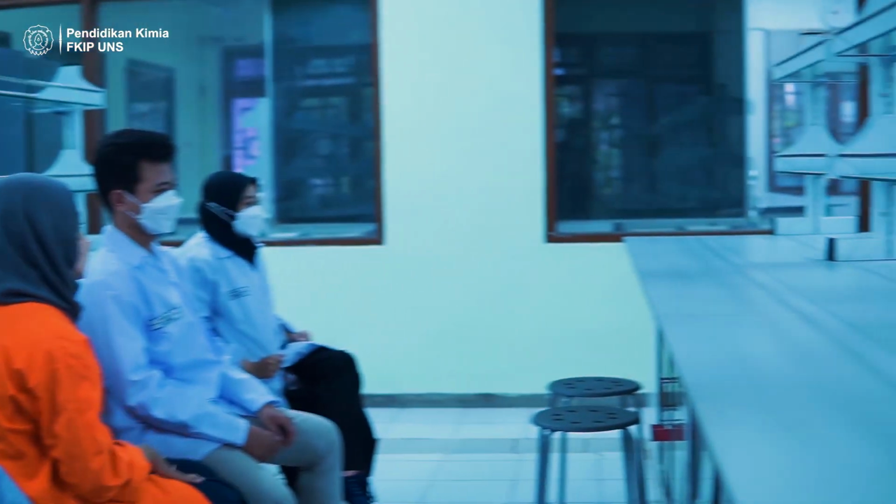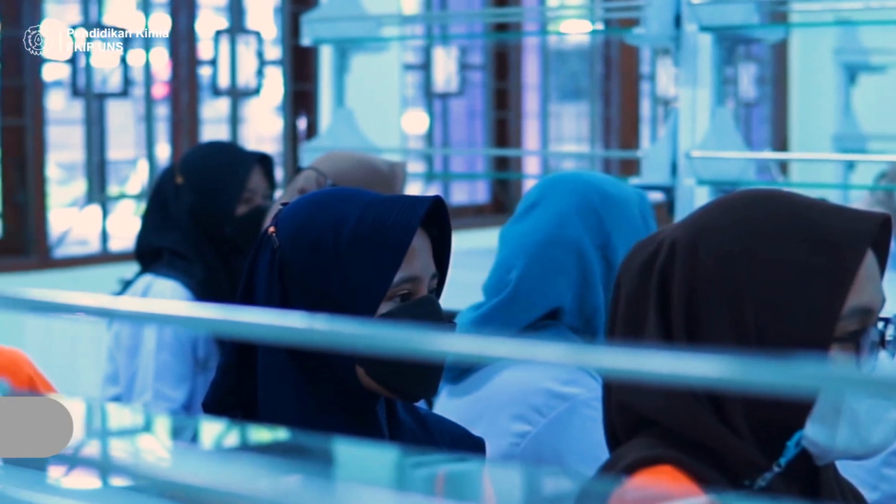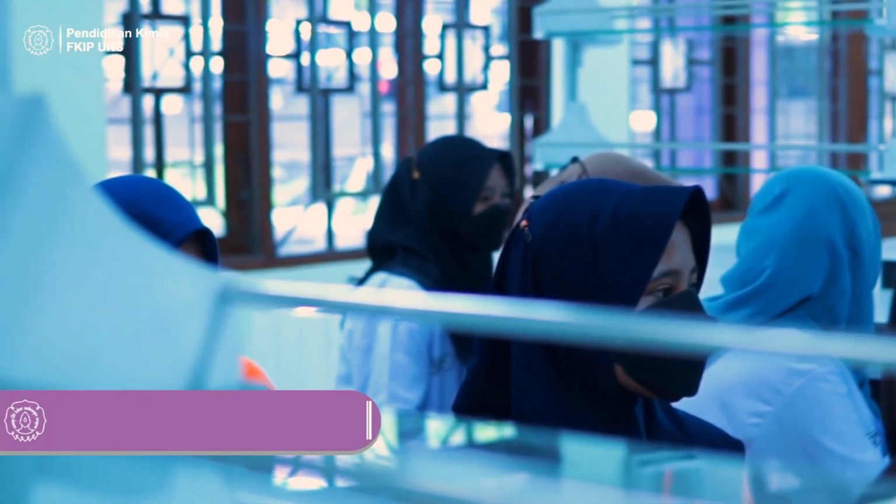We have already discussed the theory of acid-base and anthocyanins, and how to use anthocyanin as pH indicators. Now we are going to practice how to make our own pH indicators by using the selected natural products that you have already discussed in your group.